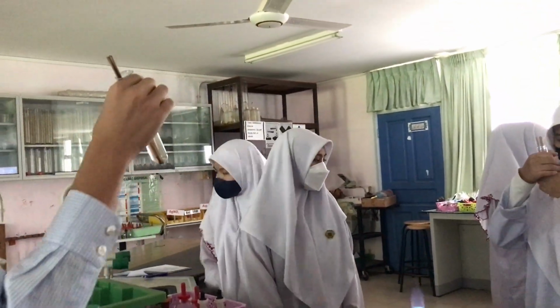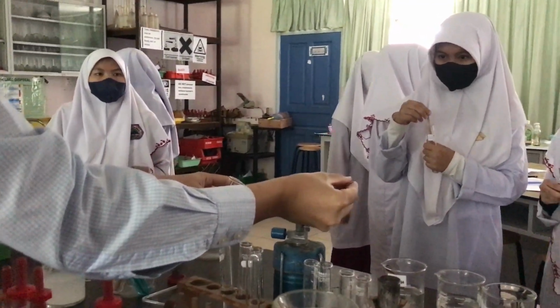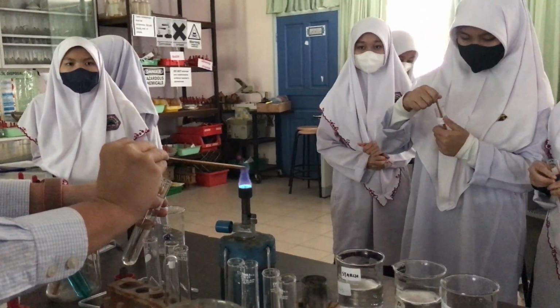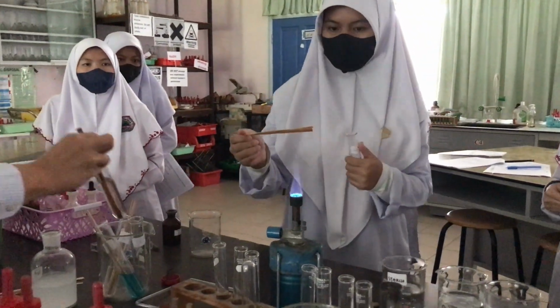The solution is colorless. For colorless solutions, you are not doing the color of the solution, you are doing the flame test. So that is your red color, flame test, the red color. Li plus, flame test is red color. Who's the next one? What is below lithium? Sodium, come sodium. You're next.